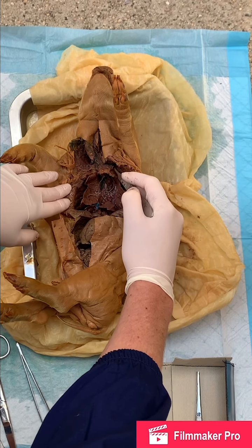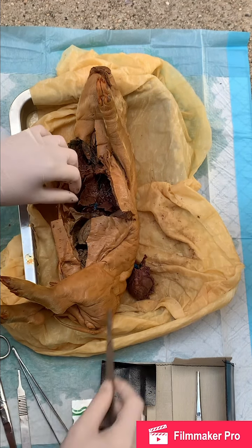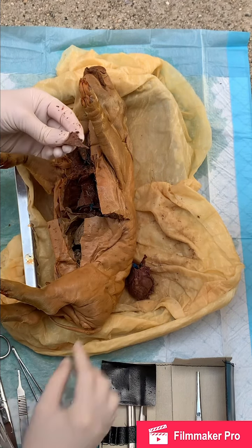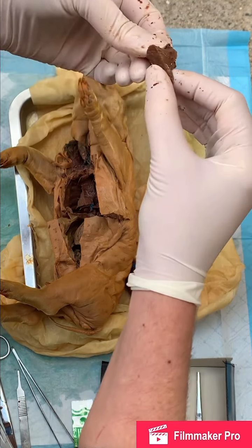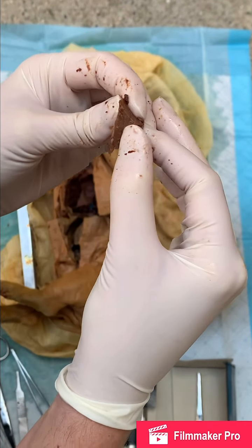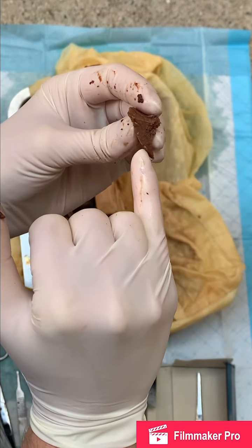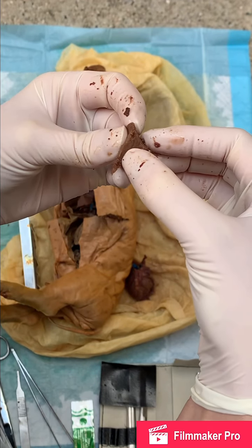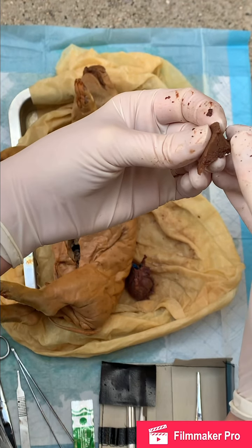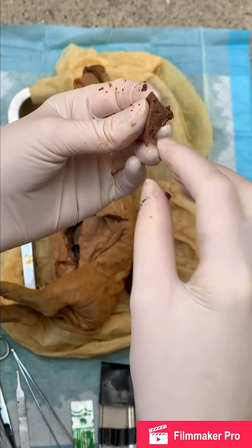When looking at the cavities of the lungs, you have the pleural cavity, which is in between the parietal and the visceral. So if I cut this lung, you can't see much tissue because we don't have a microscope in order to see the cavities of this. But the innermost layer would be your visceral, and the outermost would be the parietal. This would all be along the wall of the lungs right here. You can see the tissue is a little lighter than the inside. This has the pleural cavity, which helps to lubricate in between the 2 layers so that it prevents friction while you're breathing.